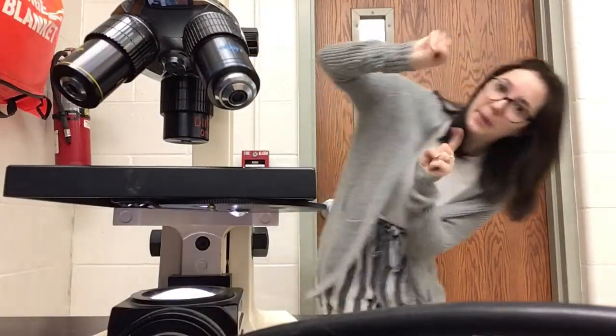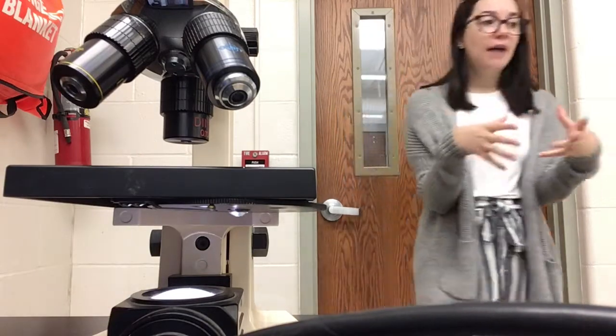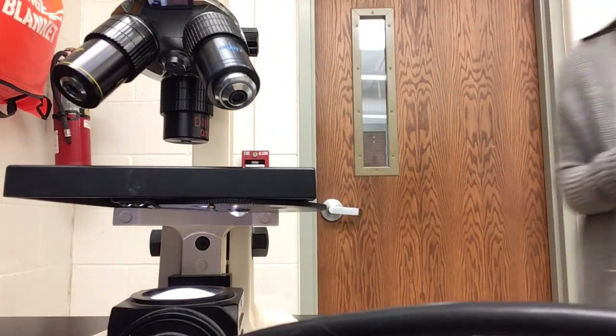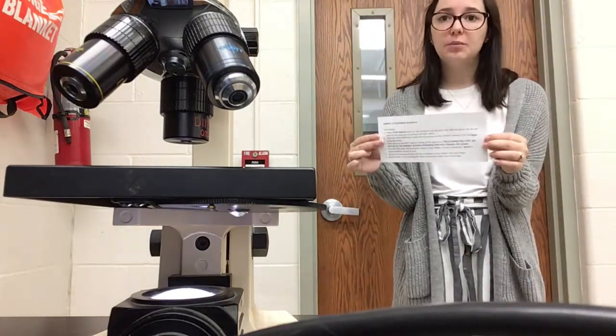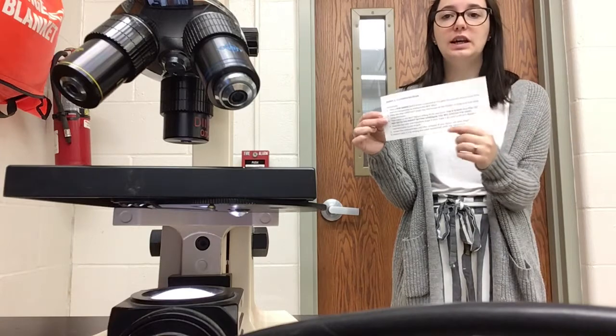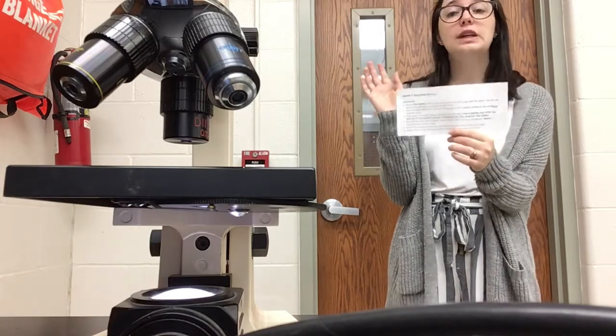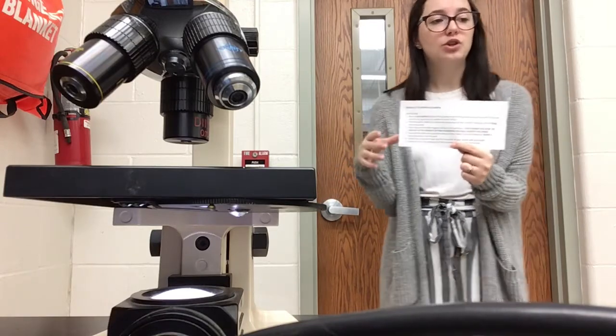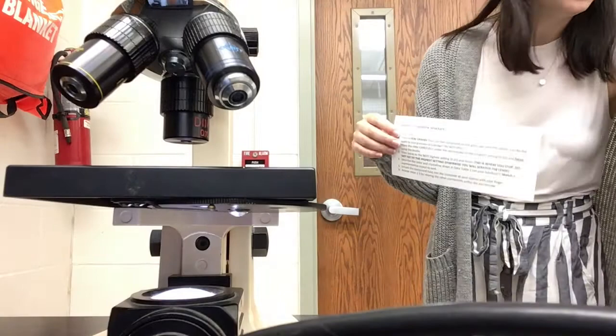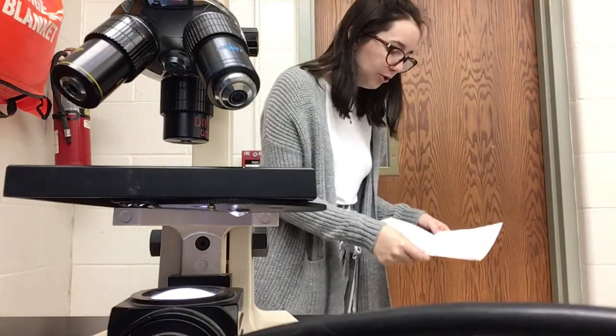Now, station number 1 requires the use of a microscope. I know this is kind of a weird angle. I have the procedures written down here, so I will show you what this looks like and I will get it set up. Because I'm dealing with a microscope, I will be changing the lens, making sure it's a clear image. So I will attach photos of what the crystal looks like, and you can make observations based on that. You can find the procedure on your lab guide. So I'm going to follow that with you.